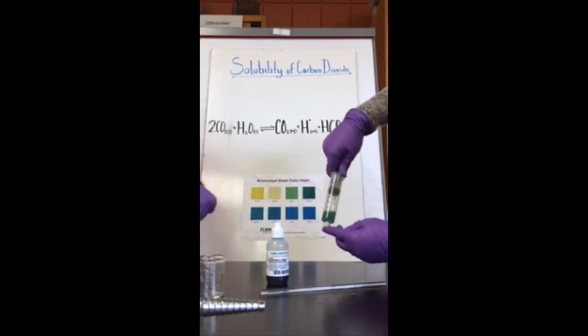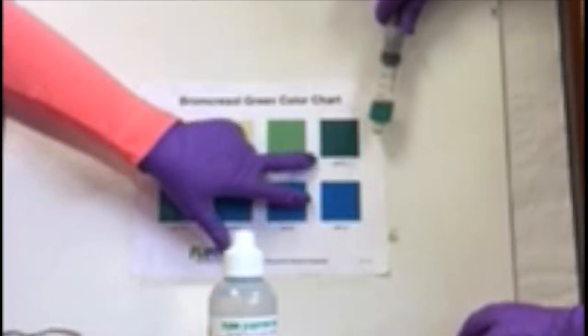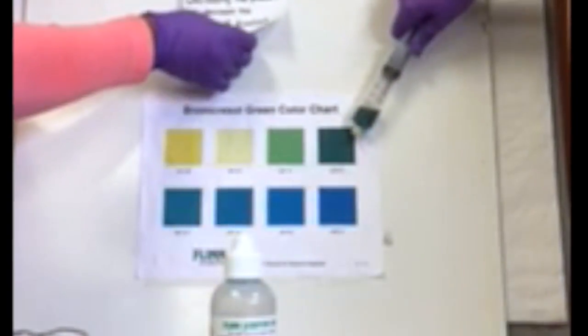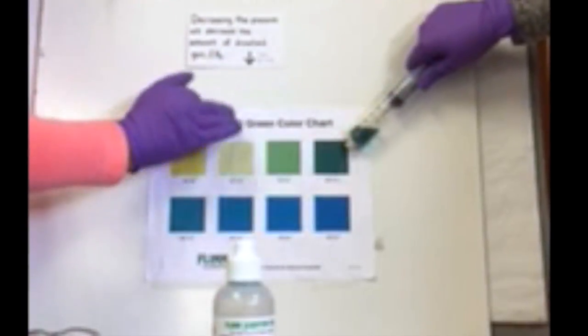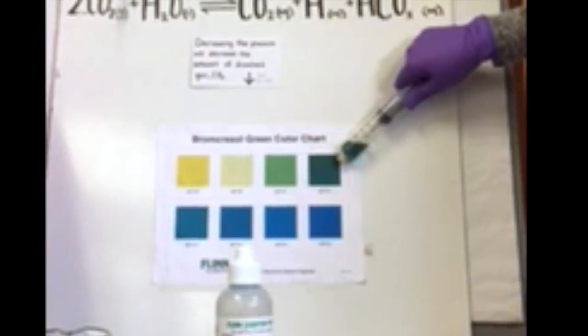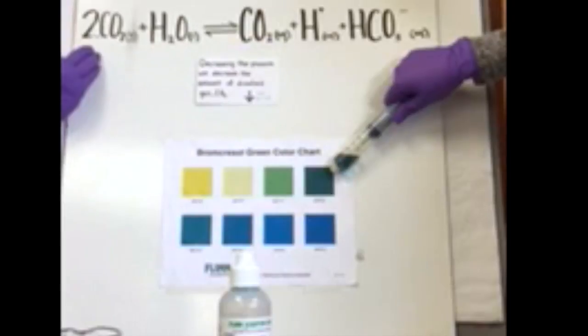Okay, so as we can see, the color changed and the pH is now about 4.4. So as we see, decreasing the pressure will decrease the amount of dissolved gas, CO2. So it'll turn this teal color, which is at 4.4. And when we decrease the pressure, the equilibrium moves to the left.